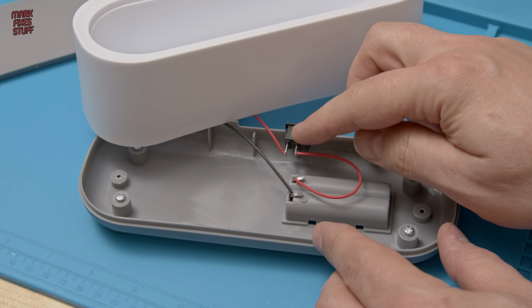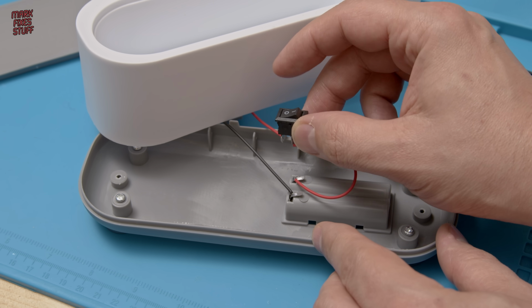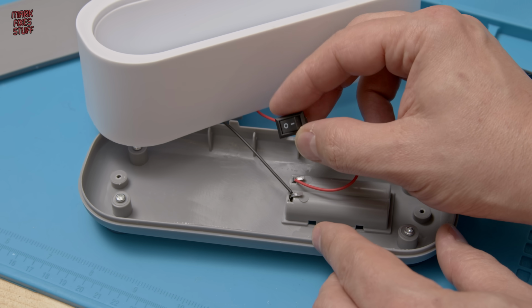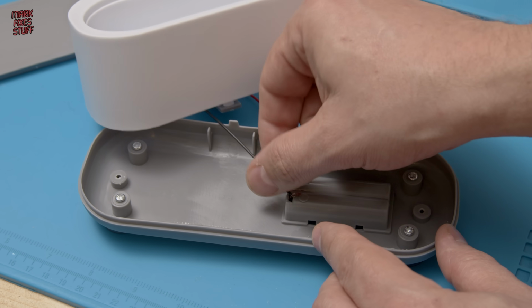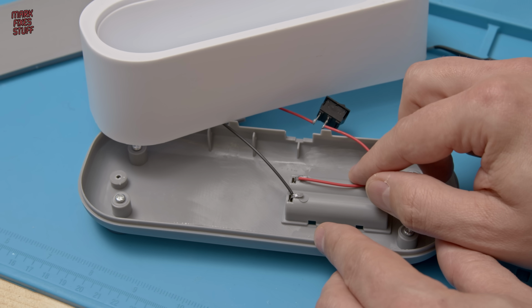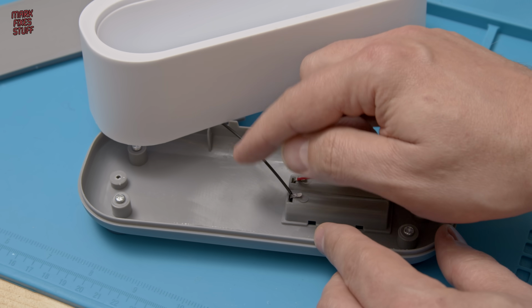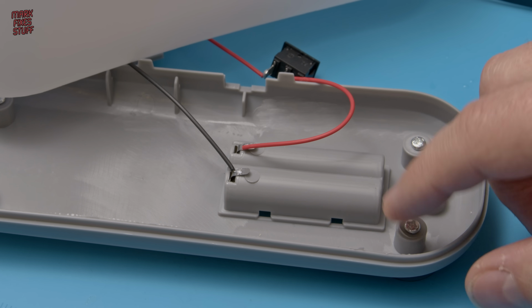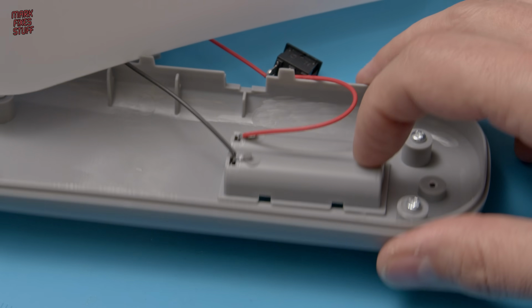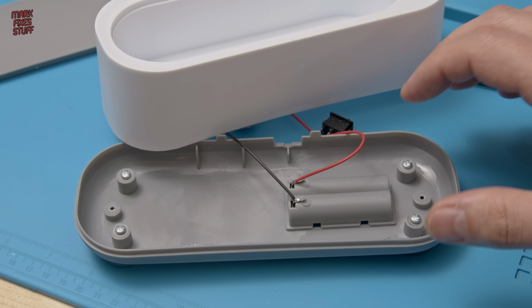And let's start on a positive note. This switch, I actually need one of these. I'll tell you why in a minute. Handy. Also, the wiring, they've used red and black. Often in these cheap electronics you'll find everything's either black or red or sometimes a meaningless colour, so that's, well, smiling through the pain. These rubber feet are actually screwed in as well, so you could potentially use those in another project. I'm aware I'm grasping at straws here.